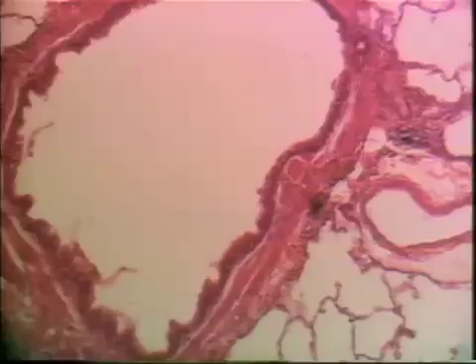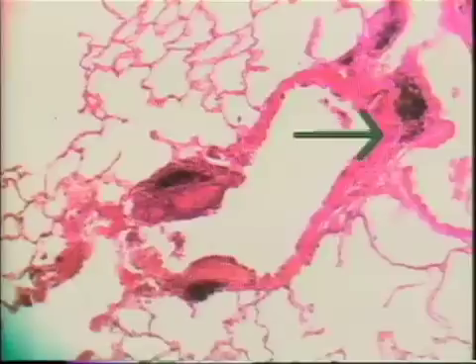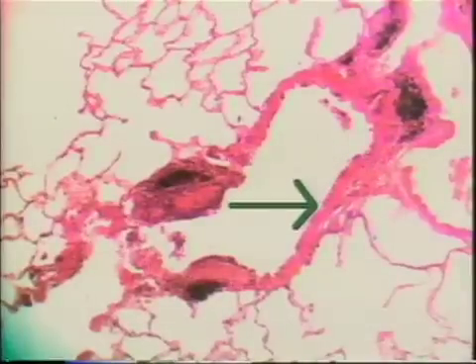The next tissue in the conducting system is the terminal bronchiole. Three important characteristics: first, a large increase in the proportion of smooth muscle in the wall. Second, we now have a simple ciliated epithelium, in contrast to the pseudostratified epithelium before. Third, there are no longer goblet cells. You can see the increased smooth muscle here in the wall, a simple ciliated epithelium, and no goblet cells.